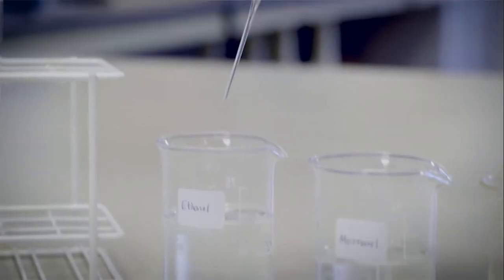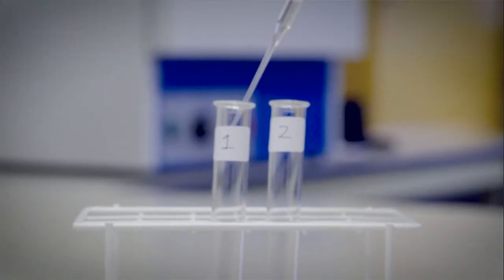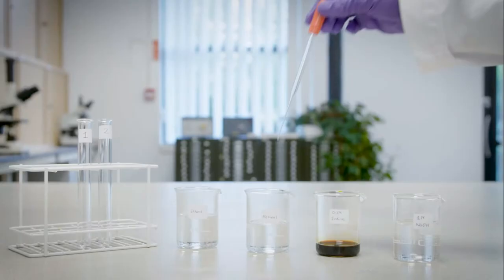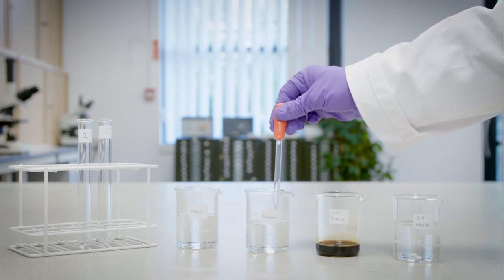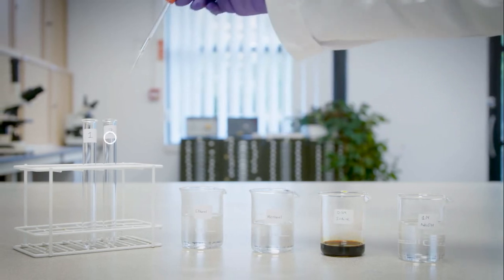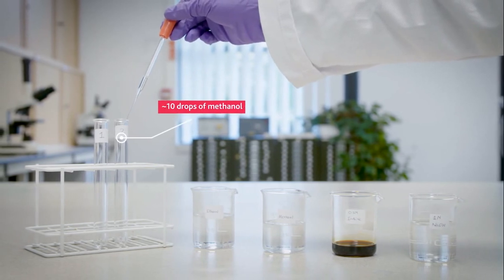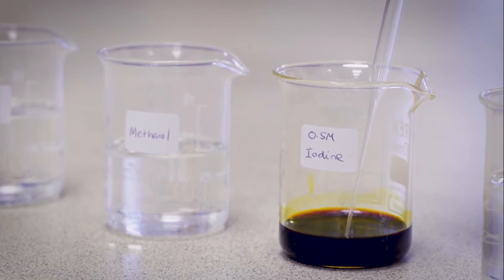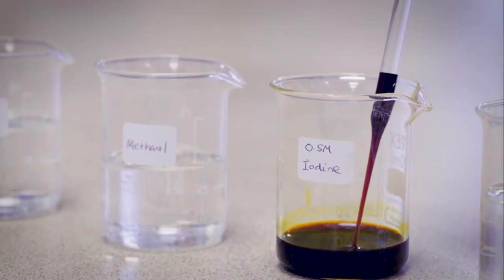First, ethanol is added to test tube 1. And methanol is added to test tube 2. Then, iodine solution is added to each test tube.